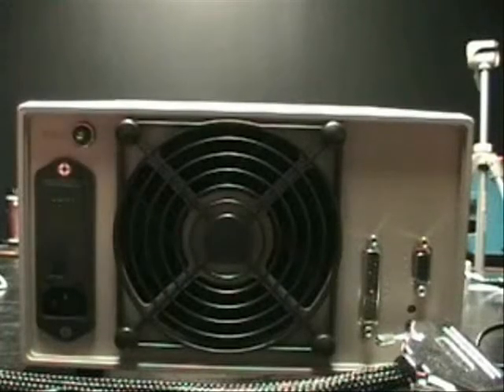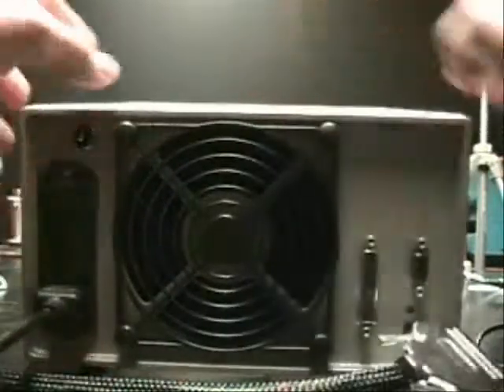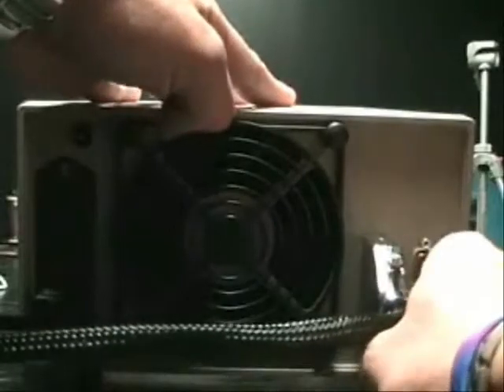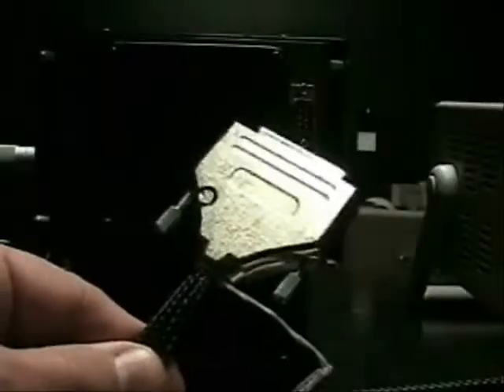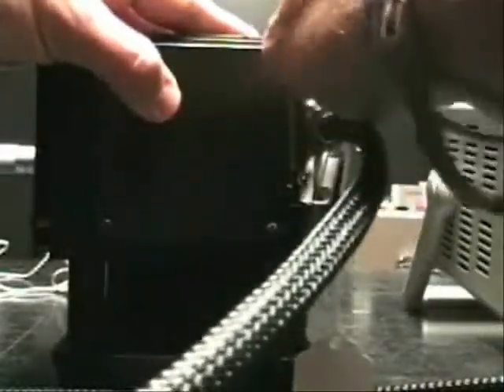Connections are fairly straightforward. You simply plug in your power wire and your communications cable, and make sure to tighten down both screws. The same is true for the optics head — attach your communications cable and tighten.